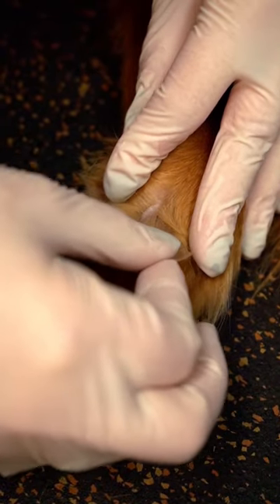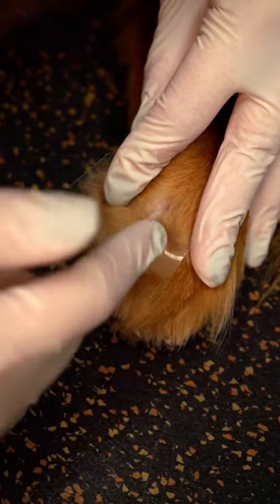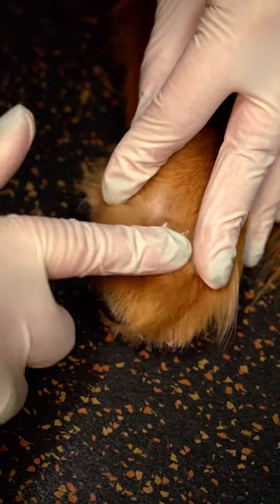First, we will grab a small piece of tape and press firmly down on the problem area of the patient. Scrape or rub the tape back and forth with your finger 10 times while trying to avoid any hair or other contaminants.